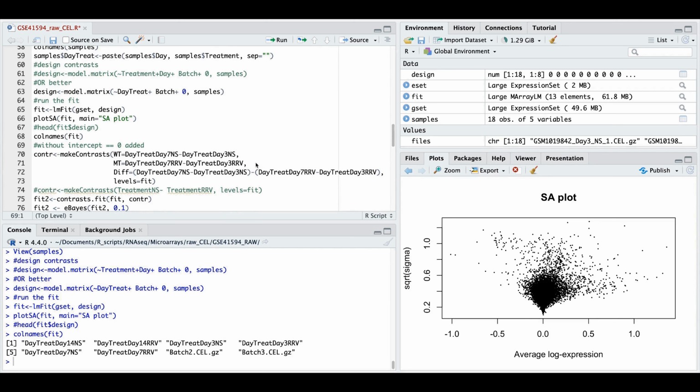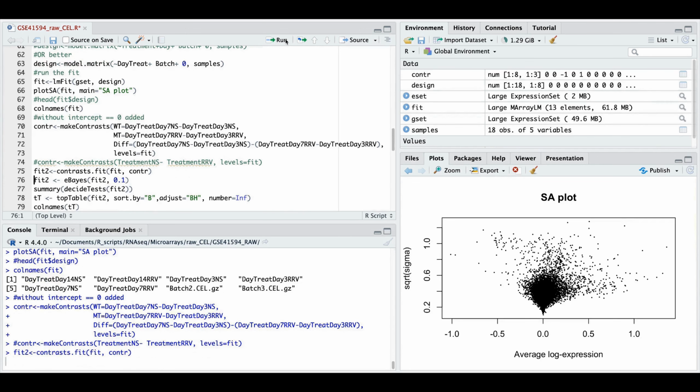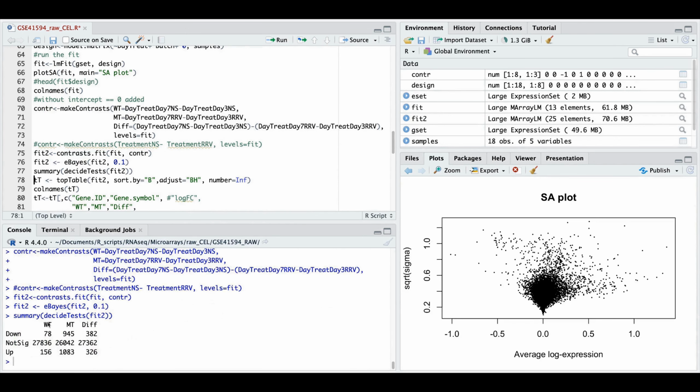We say, let's take those expressions which differ from day 7 and day 3 for wild type and the viral type, which we call MT, and then take a difference of those two. Limma is beautiful in this respect. And then do a contrast fit and eBayes and the summary. And the summary is also quite nice.